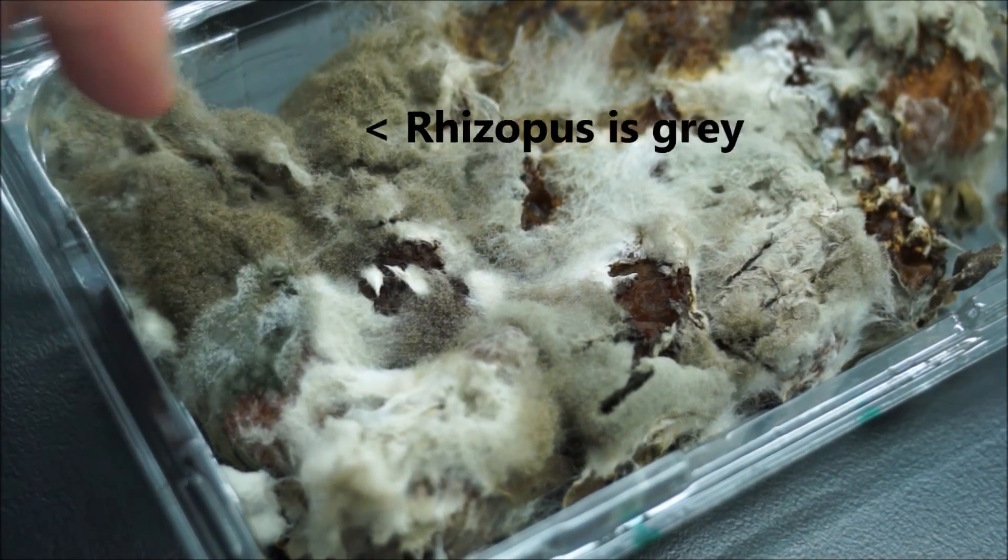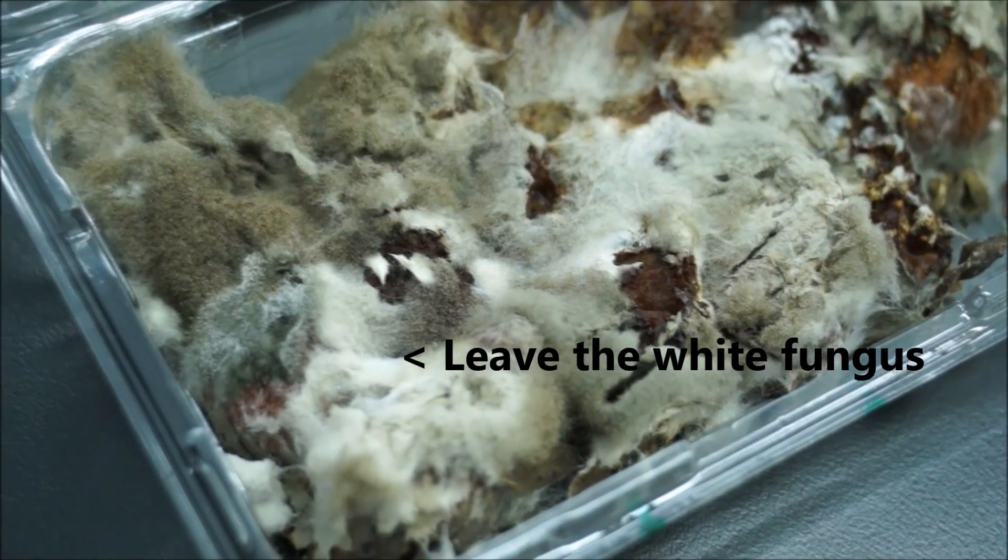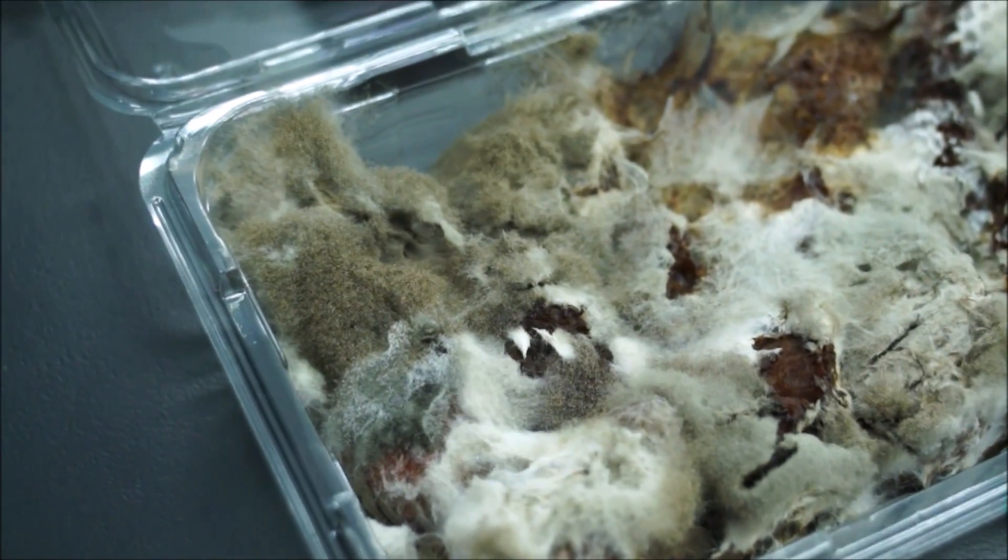So Rhizopus will be this one over here. Some of these other ones, the different colored ones, should leave alone. I'd go for this grey one.